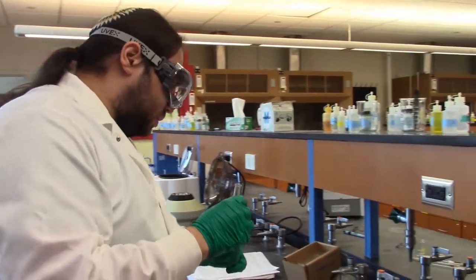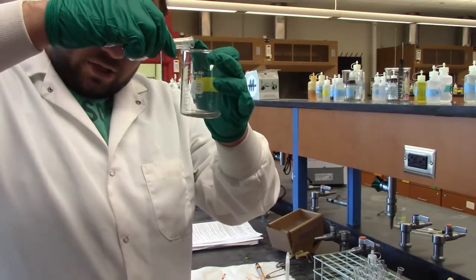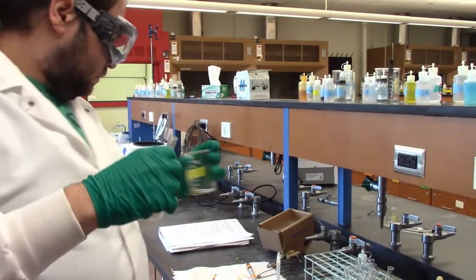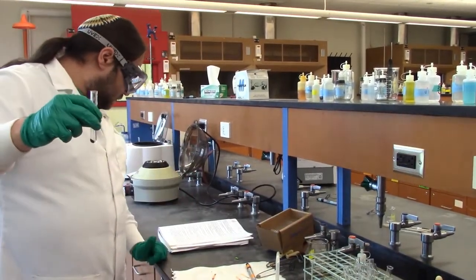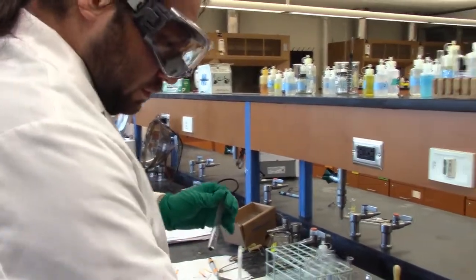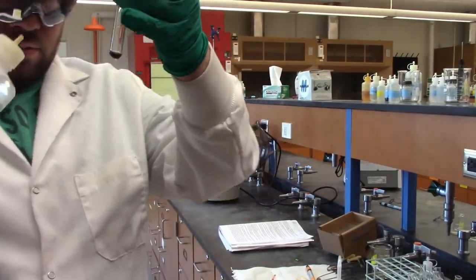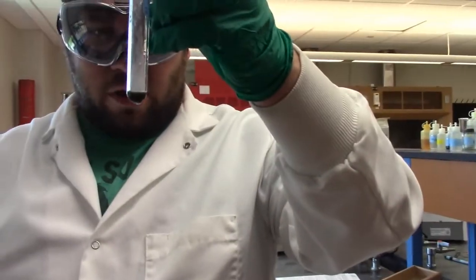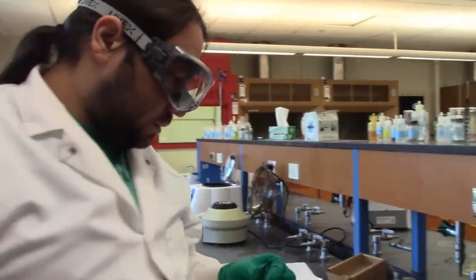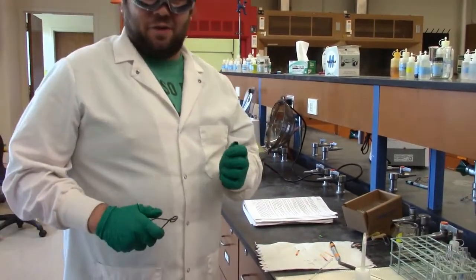But still, because it's a wash, let's get rid of our supernatant. We're keeping the precipitate, that's the thing that has all the stuff. So there it goes. Now that I have that, I'm going to add 2 drops of HCl. You can see there is some gas coming off of that as we dissolve all the stuff. And from there, we're going to heat again and centrifuge again. There's a pattern going on if you haven't figured it out.